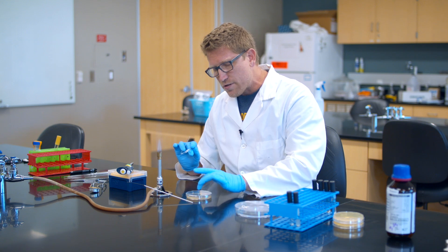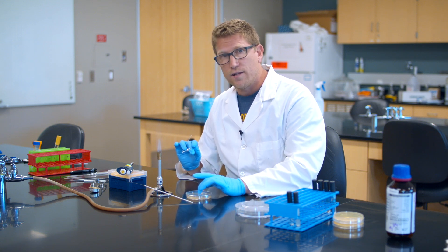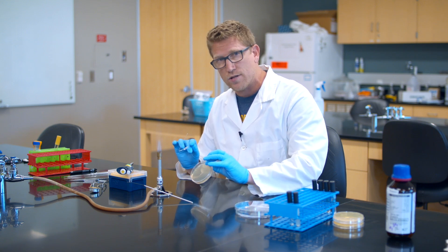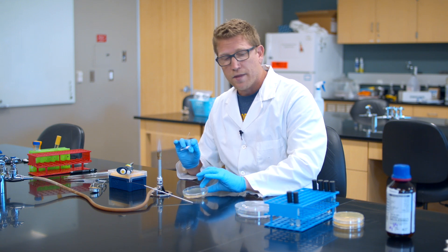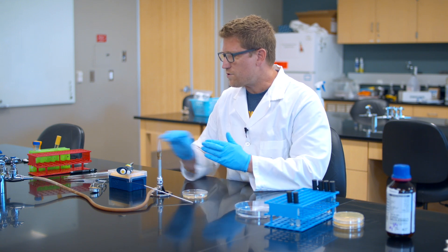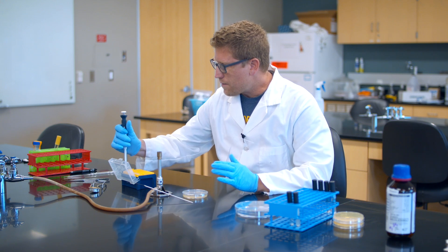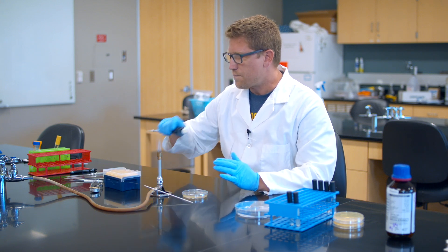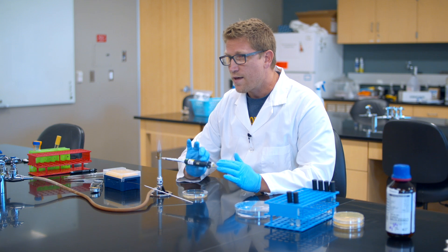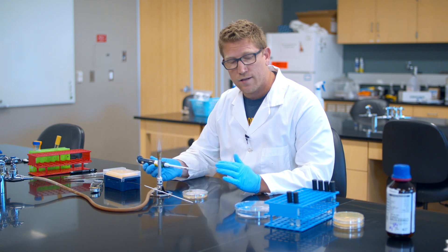And all I'm going to do is I'm going to add a small volume of liquid bacteria to my petri dish and then use the spreader to move it around. So I'm going to transfer that volume using a micropipetter. This is a P200 micropipetter. I've put a plastic tip on the end, a disposable tip.